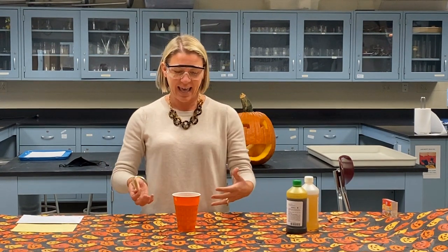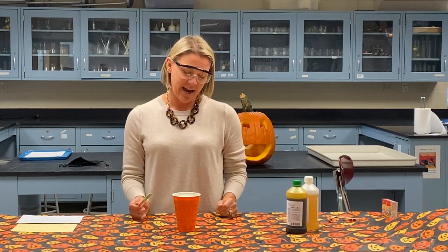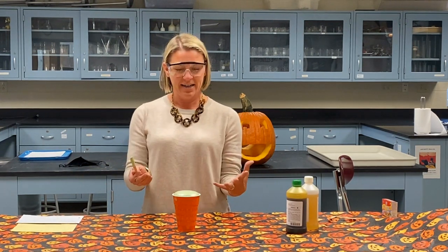And so we have that gas. It's a little bit bubbly, you can see, so that carbon dioxide gas is trapped in there, causing the volume to expand. This is slightly warm on the outside, so it's another exothermic reaction. And once this comes up to the top and stops rising, it'll harden. So here it comes. You can see it.